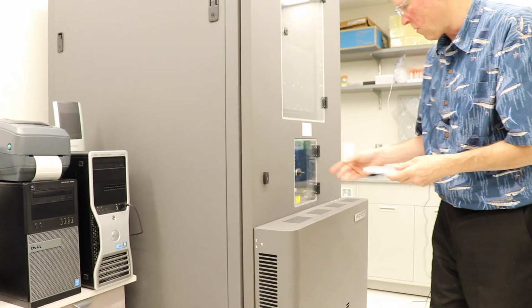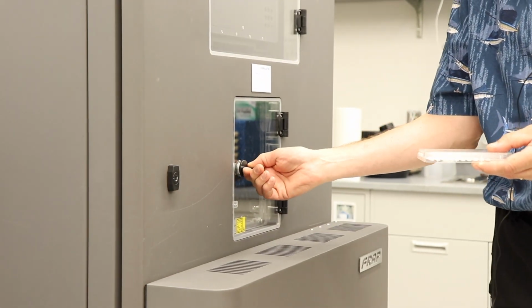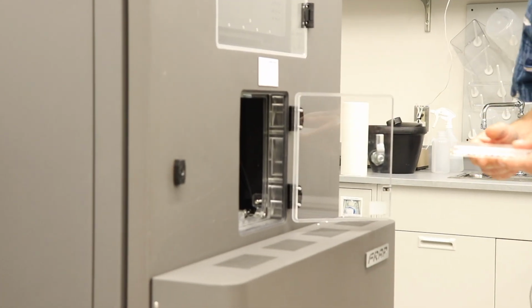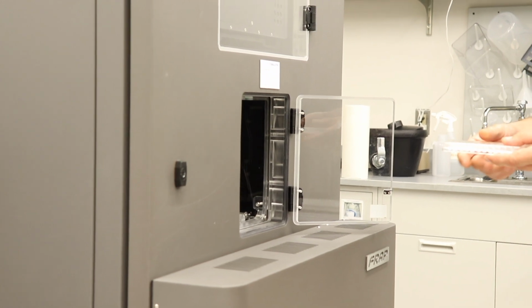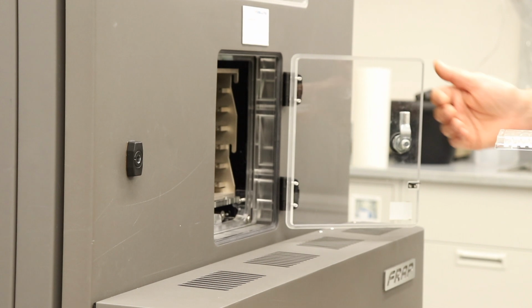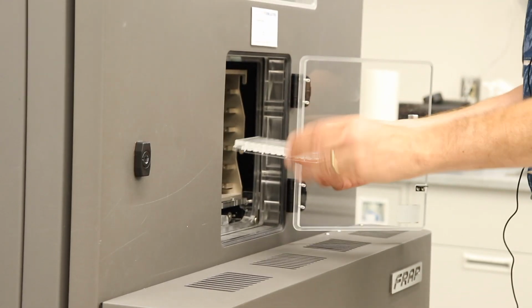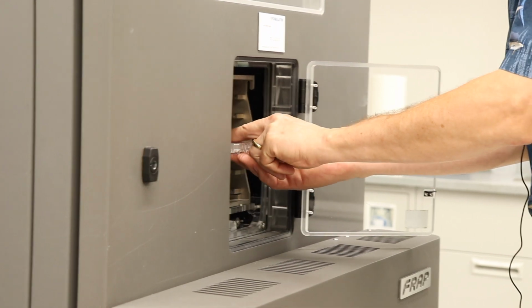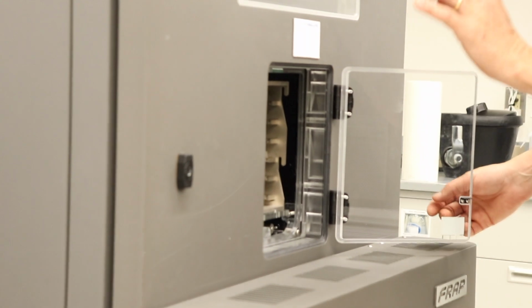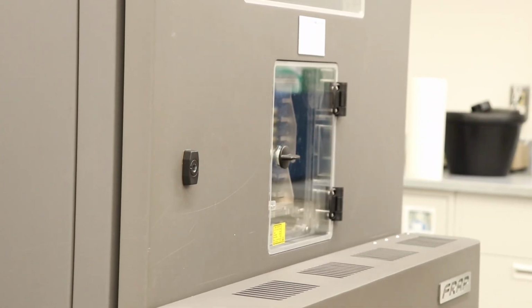At that point, you'll carefully take your plate or plates and bring them over to the load port hotel. You can put up to 6 plates in at once. So when you open the door, the load port hotel should come out towards you. If it doesn't, close the door, wait a few seconds and open it again, and it should come out towards you. You want to take it and barcode in, fit it into one of the 6 slots, it doesn't matter which one, and it should fit snugly right in there. Then close the door and lock it.